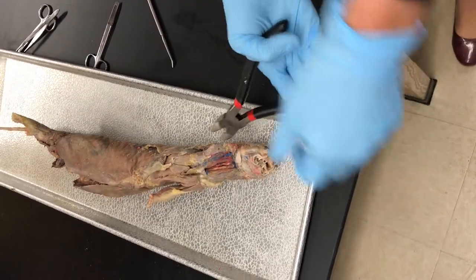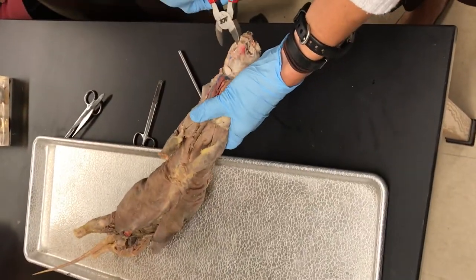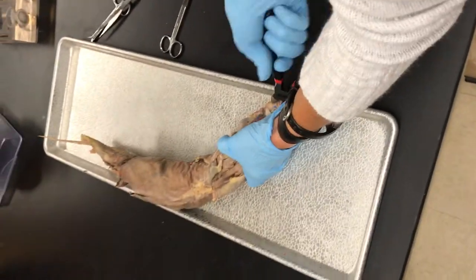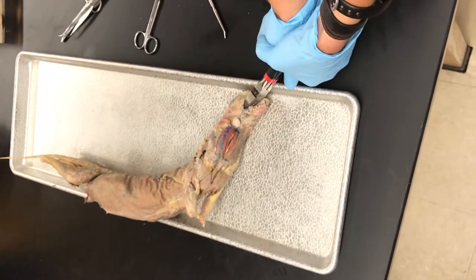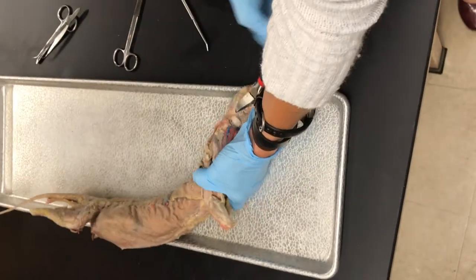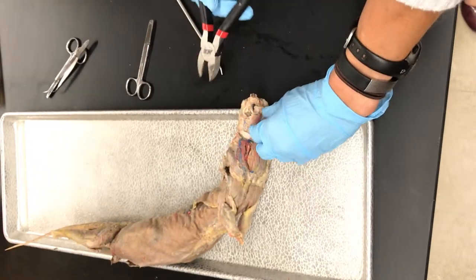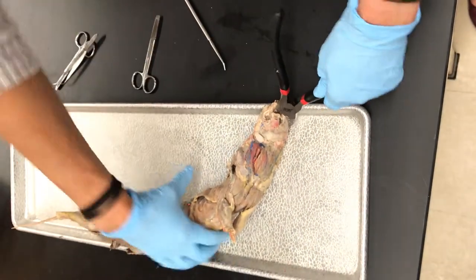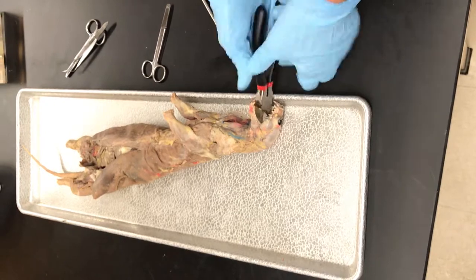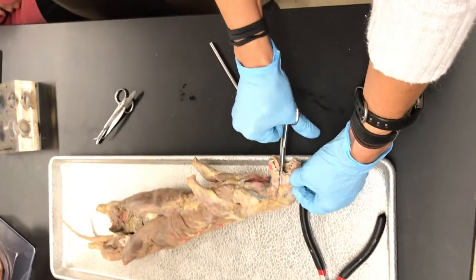The oral cavity - to get into it, I usually put one edge inside his mouth. And then you just push down on it, because basically we want to open the oral cavity so that his chin is going to touch his chest. So we've got to get that jaw opened up.